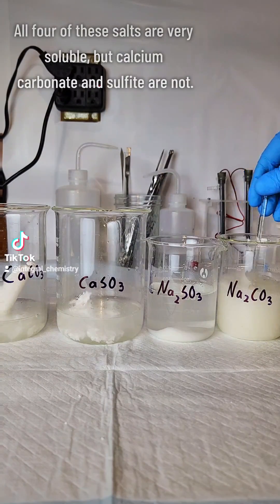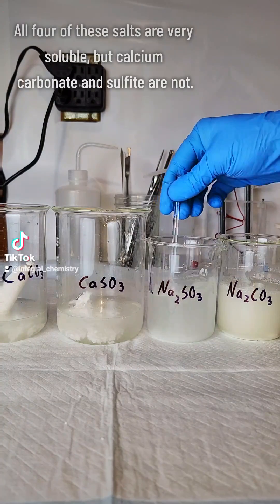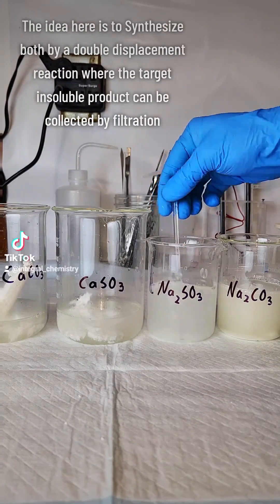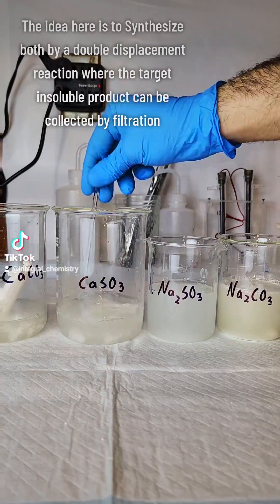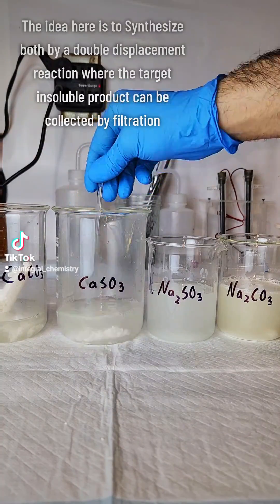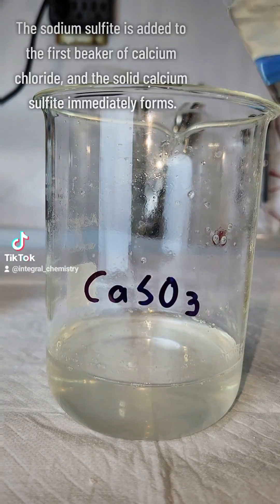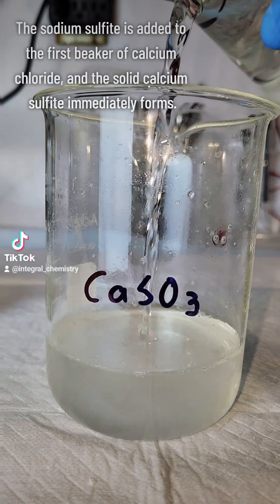The sodium salts of carbonate and sulfite are very soluble, but their calcium salts are not. With that in mind, the idea here is to synthesize both by a double displacement reaction where the target insoluble product can be filtered off and collected.